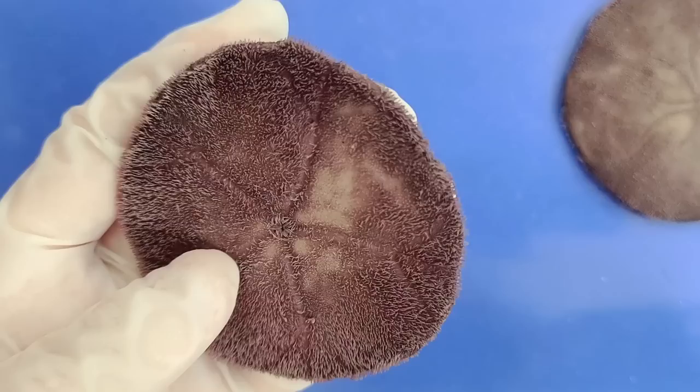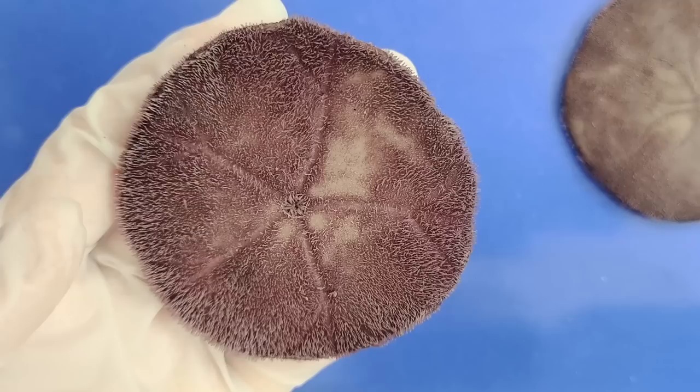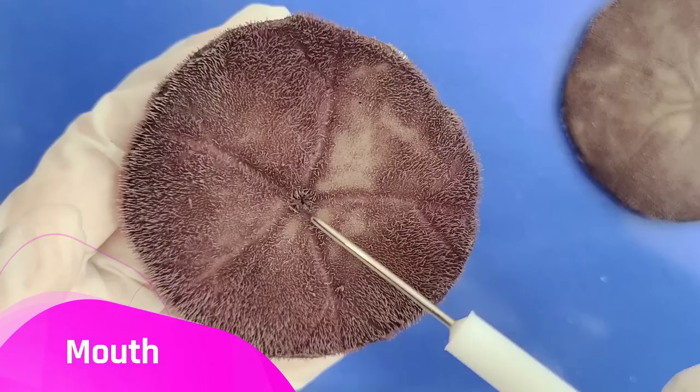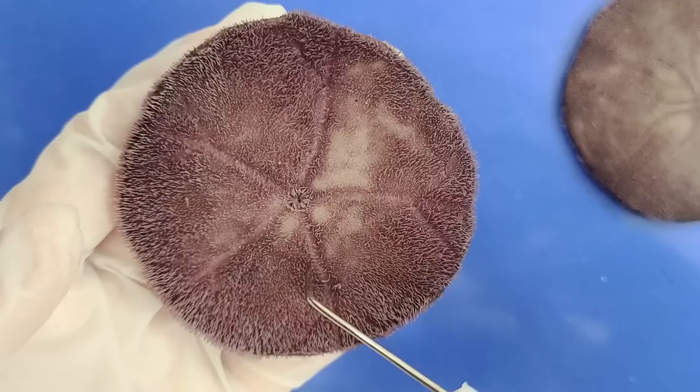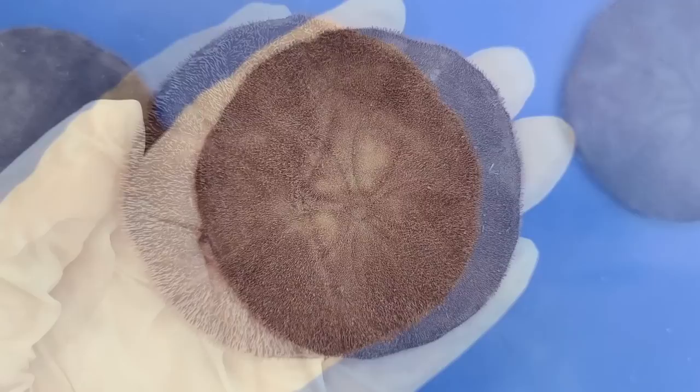You can't really see the tube feet since they're very thin and delicate, but we'll put a picture of it here so you can see what it looks like. The tube feet and spines also function in feeding — they grab onto tiny food particles like algae and plankton, and push the food along these five food grooves, all of which lead to the mouth. Through the position of these five food grooves, you can see that sand dollars, just like sea urchins, exhibit radial symmetry — a symmetry around the central axis, just like the slices of a pizza.